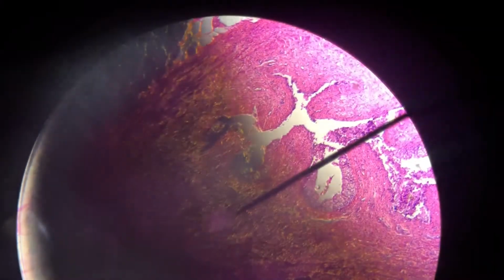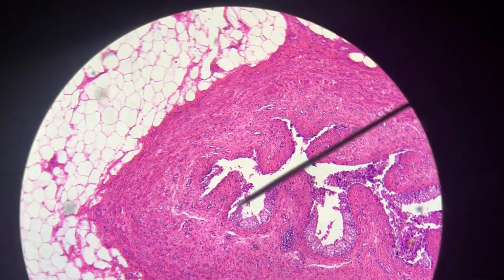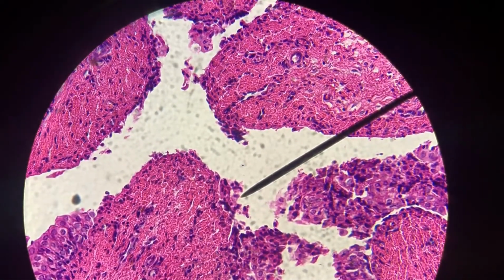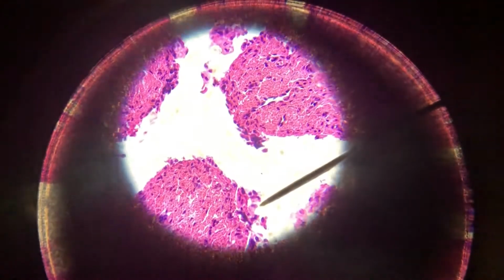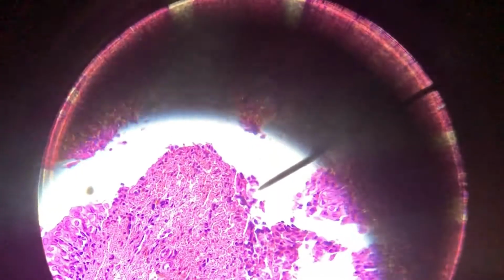So this is an entire bladder that we're looking at. And this is a big muscle called the detrusor muscle. This is the lumen where the urine is. So this is where our transitional epithelium is. Let's zoom in. What you can see about our transitional epithelial cells is that they don't quite look squamous, they don't quite look cuboidal. We definitely would never have a stratified tissue with this many layers that would be cuboidal. If you ever see stratified cuboidal, it's only like 2 layers thick. So if you've got cells stacked like this and they look cuboidal, it must be transitional.